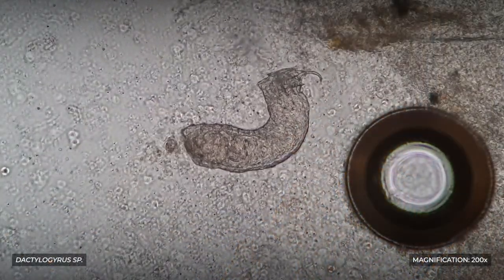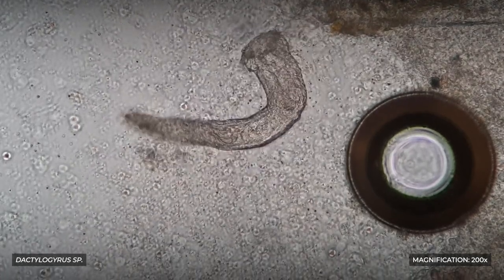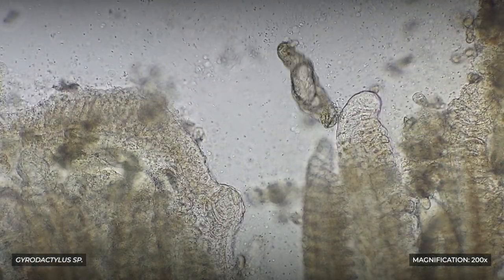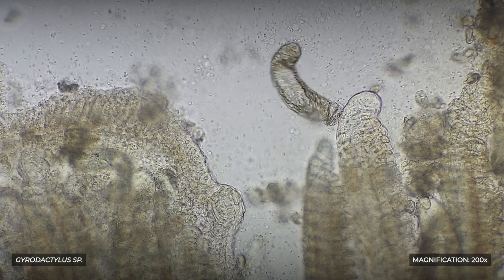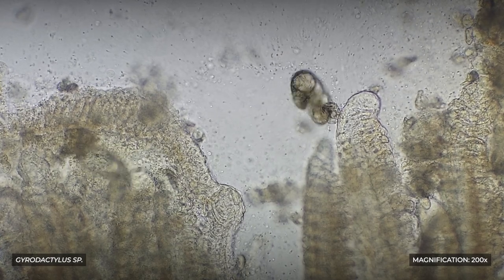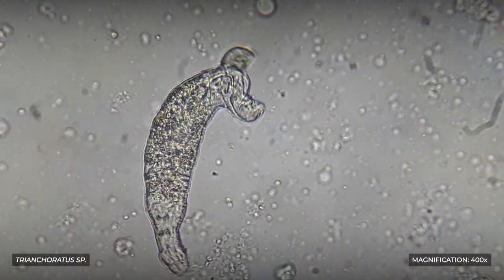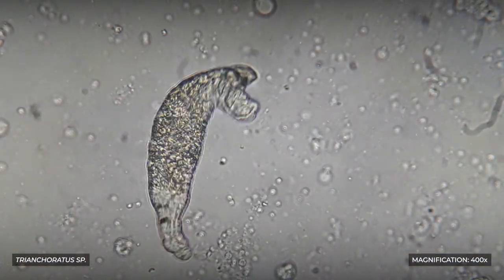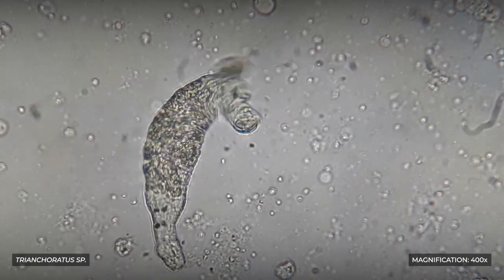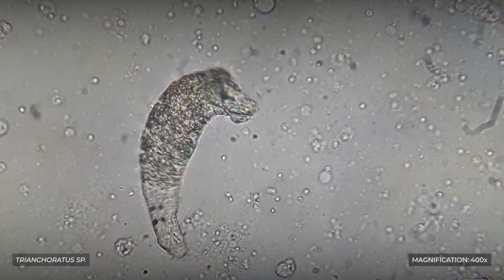Other fish species will have different species of worms. On the contrary, it is not uncommon that a fish species is a host for several different fluke species. However, these parasites share a common body design that allows for their identification. Let's look at some of them in more detail.